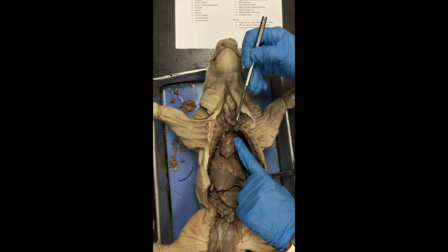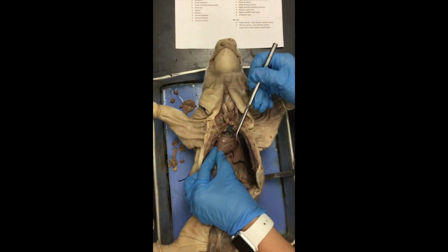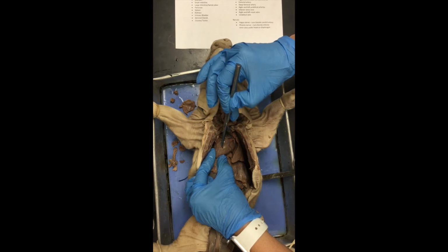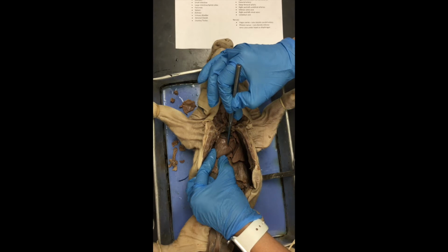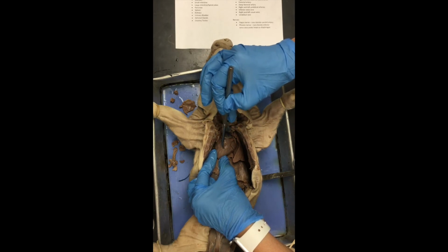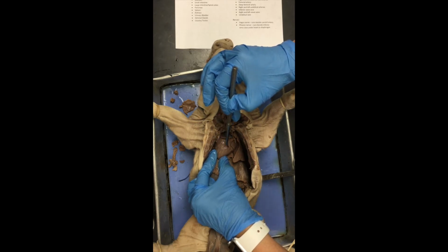And running on the surface of the heart, it's hard to see in this particular pig. It's really pale, but hopefully it translates to the video a little bit. But there is a vessel running right through here. That's called the coronary artery. Sometimes it may look pink, sometimes it may be kind of white or gray, and mine actually blends in with the heart itself. So mine's tough to see here on this pig, but it's there. It's running right through here, and that's called the coronary artery.